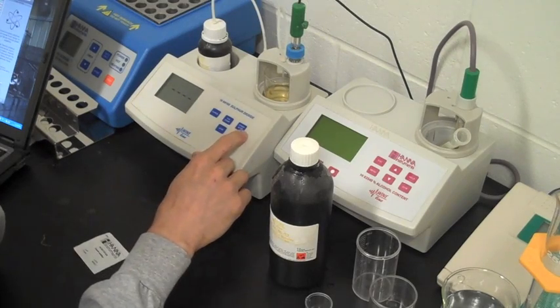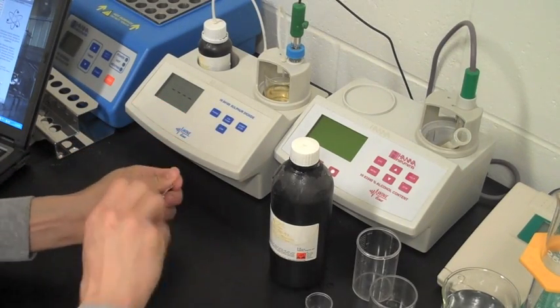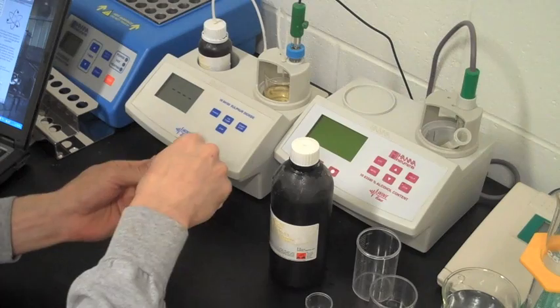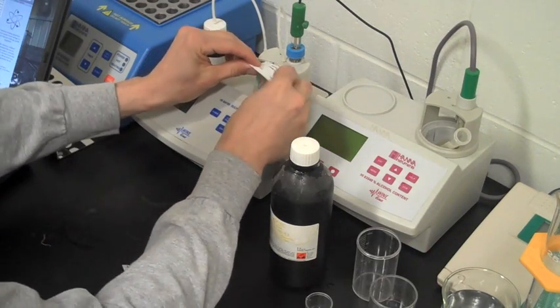And then basically, I forget, you've got to put this stuff in there. It's a powder stabilizer.